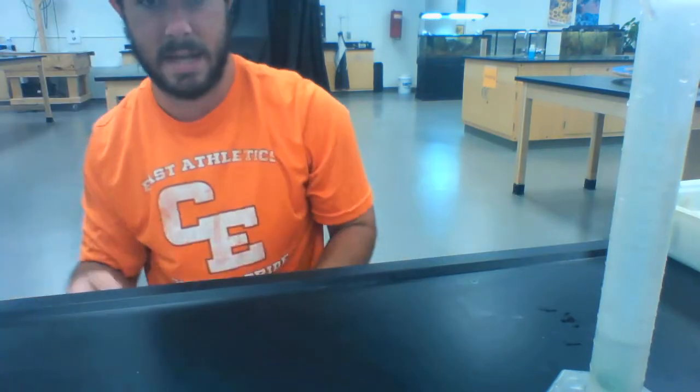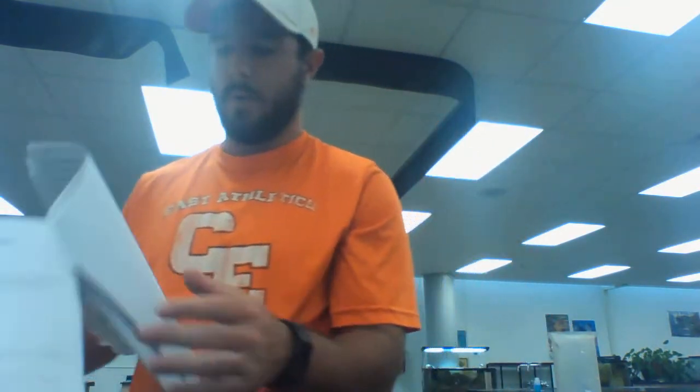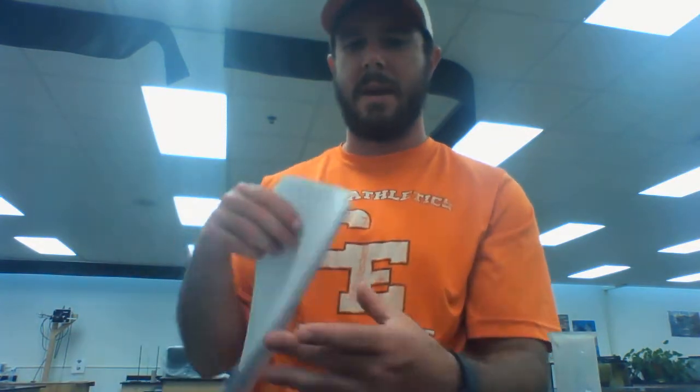If you need a second to fill that in, go ahead and pause. I'm going to move on to the next section of the lab — Part C — where we're going to use a scale like this. I'll teach you how to use it.